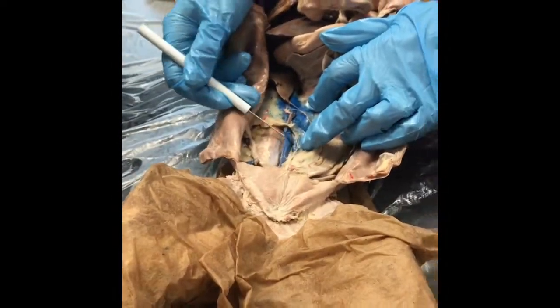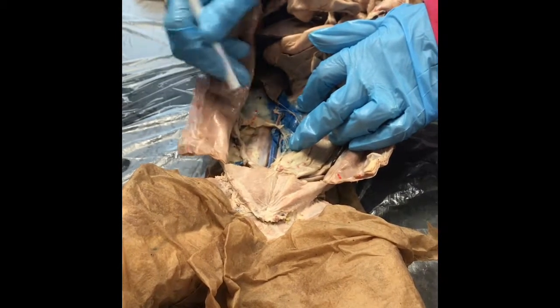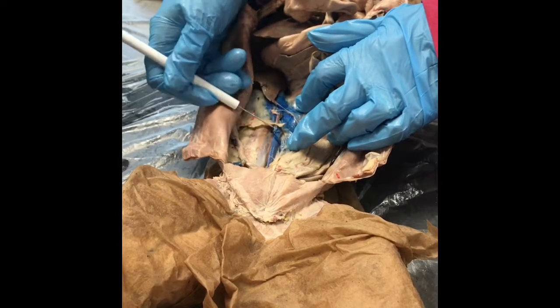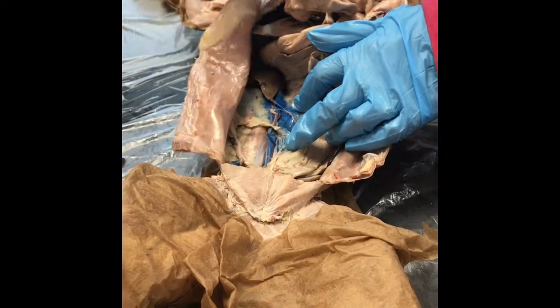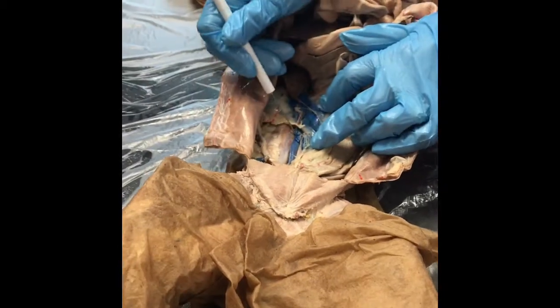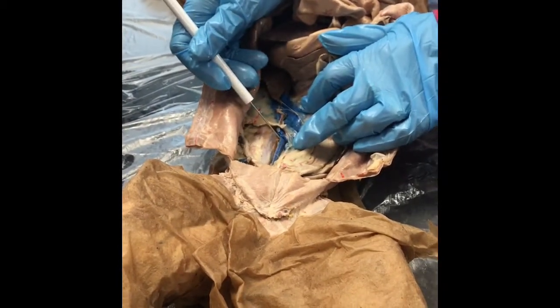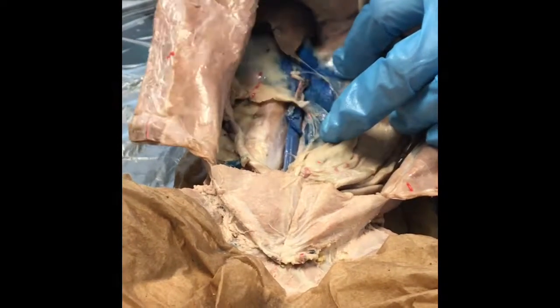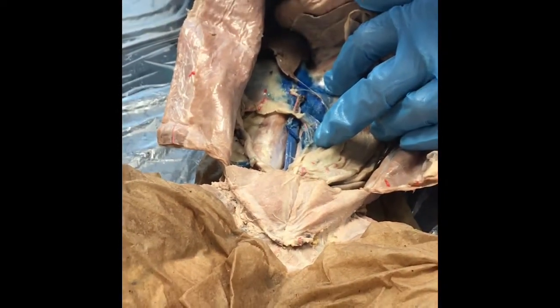That is the inferior vena cava. Very large. Okay, and then you're going to have all these branches off of the inferior vena cava. So inferior, that's below the heart. Not only can I see it up here in the thoracic area, but I'm also seeing it down here in the abdominal area. Large, large, large vessel. Blue. If it's right in the middle, inferior vena cava. So those are veins.